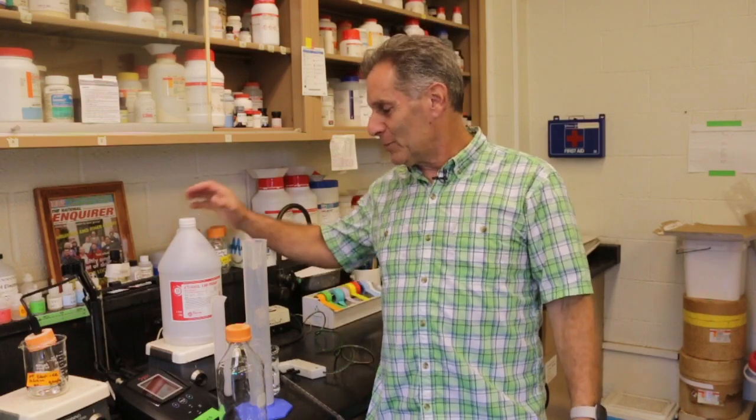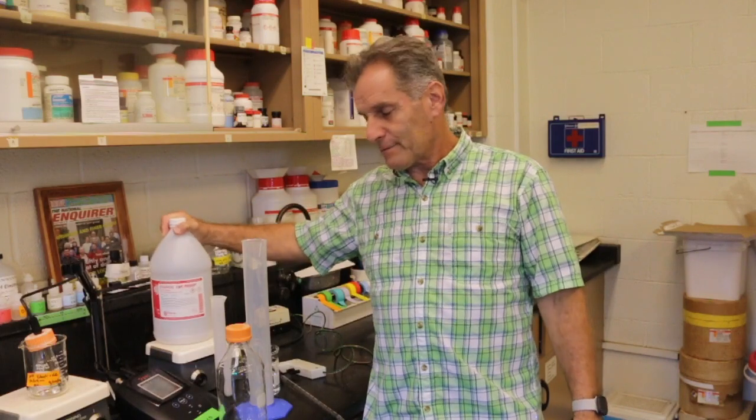So I want to kind of share with you my thoughts on this, and I really dislike the gallon, the English system or the imperial system. And again, you can't use it in the laboratory. And to give you some example of measurements, so this is a gallon, and this is the measurement in the English or the imperial system.